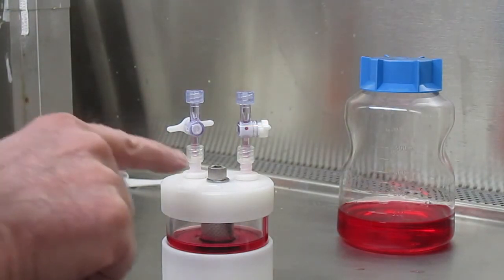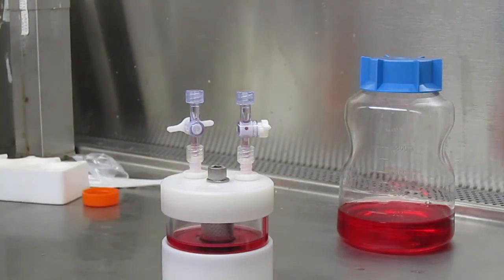Then the media is replaced as we showed with loading the vessel, and the vessel is returned to the rotator base in the incubator.